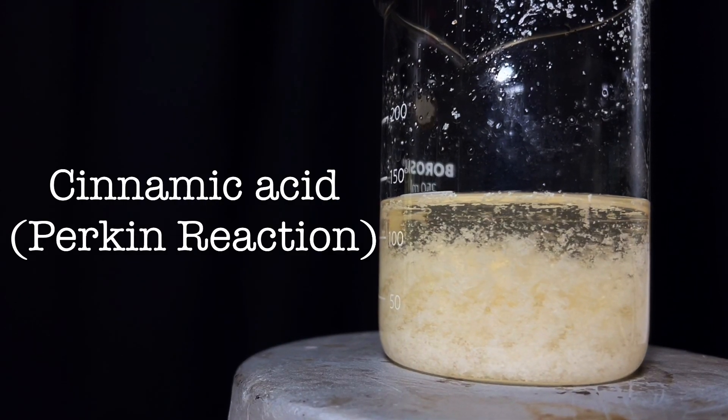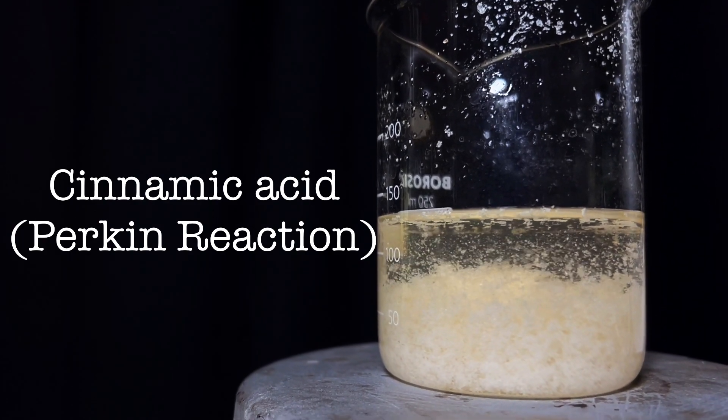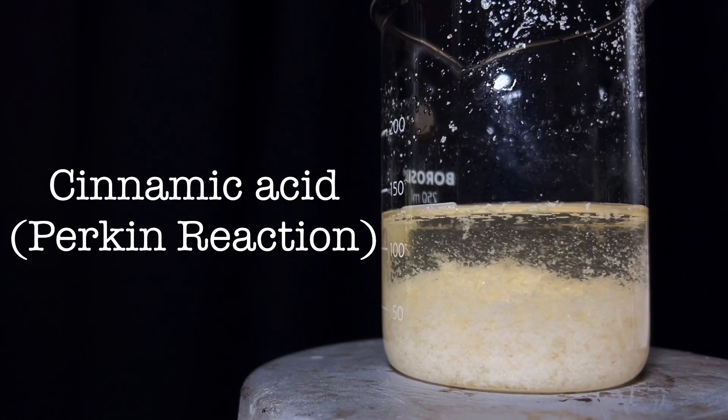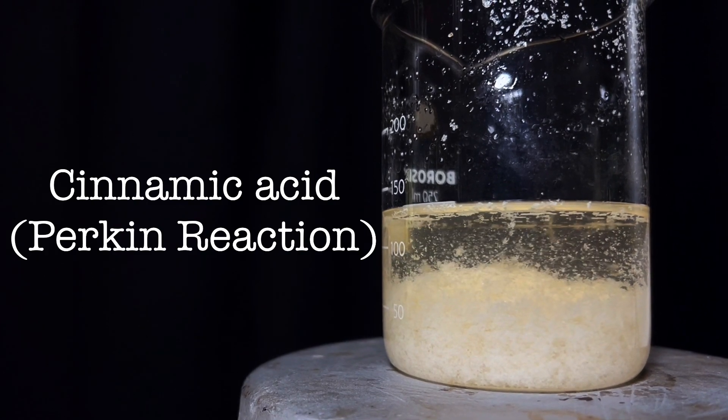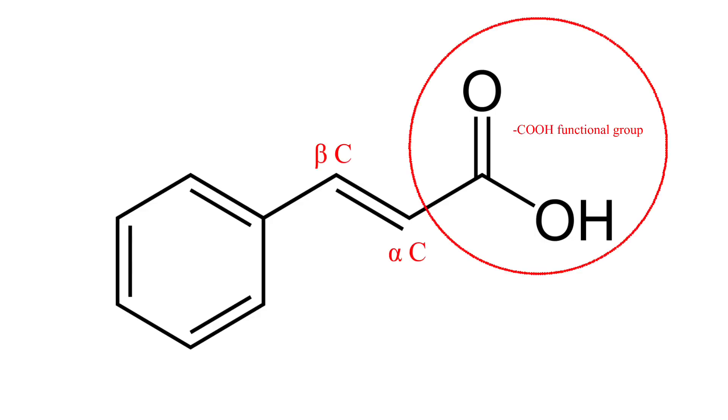Hello friends, in this video we will be synthesizing cinnamic acid via the Perkin reaction from benzaldehyde. Cinnamic acid is an aromatic acid with an alpha-beta unsaturation double bond.